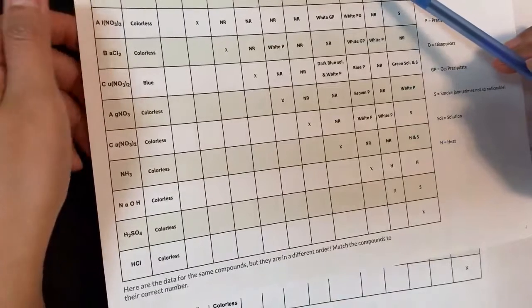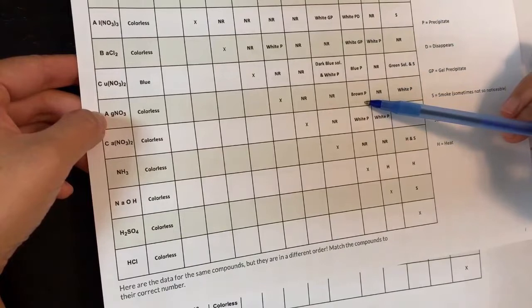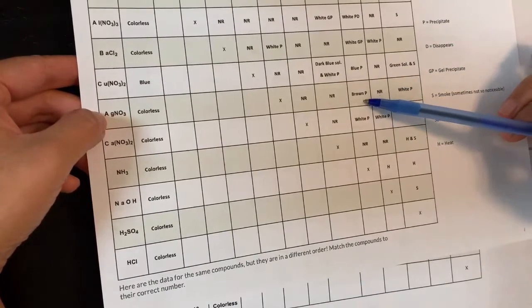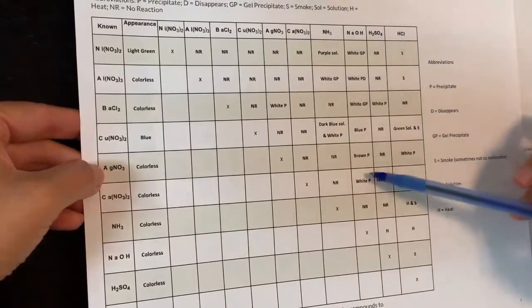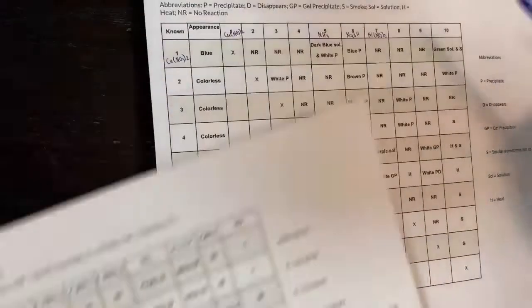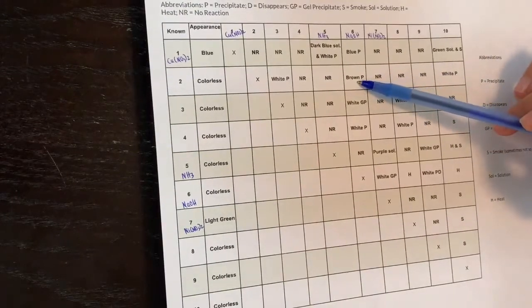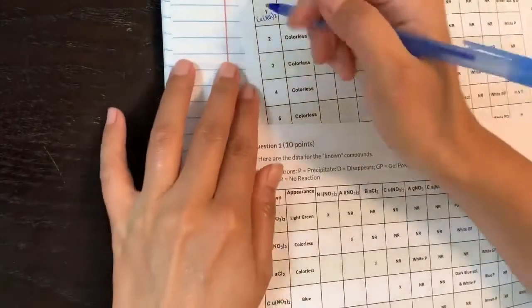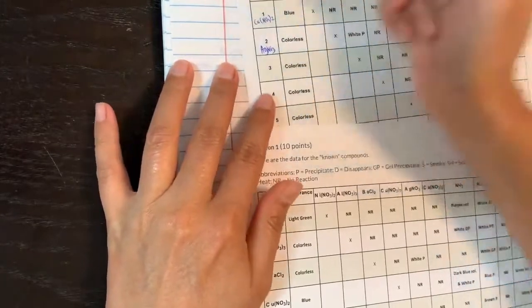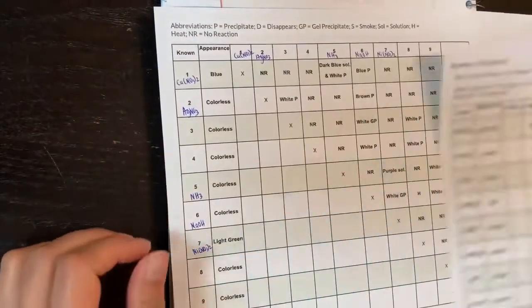Another unique observation: there's a brown precipitate visible, and in the known table only silver nitrate reacting with sodium hydroxide gives a brown precipitate. Looking at number six — which we confirmed is sodium hydroxide — the only brown precipitate it shows is with number two. Therefore, number two must be silver nitrate.